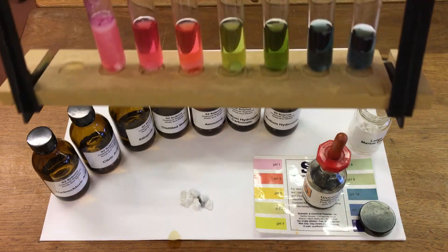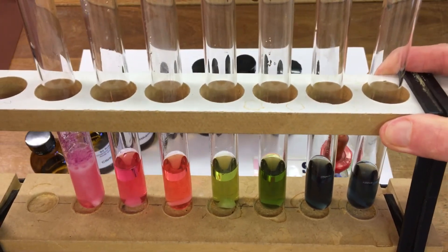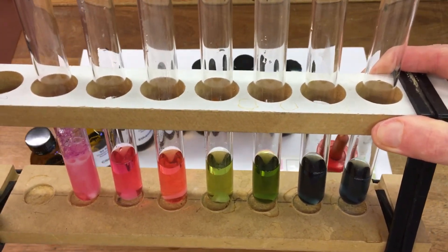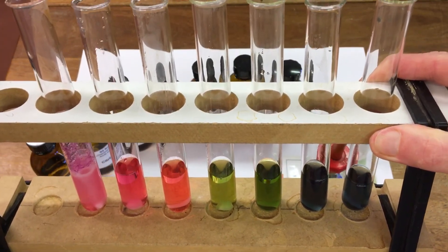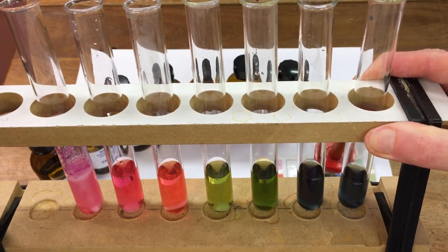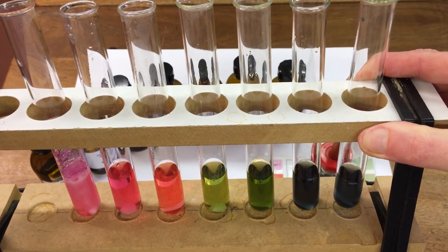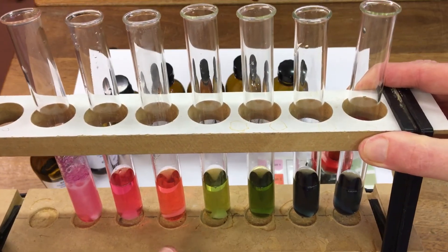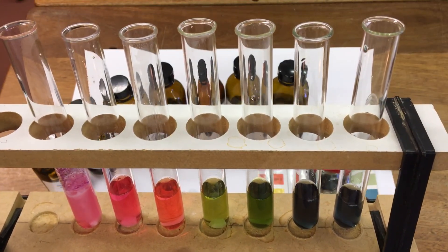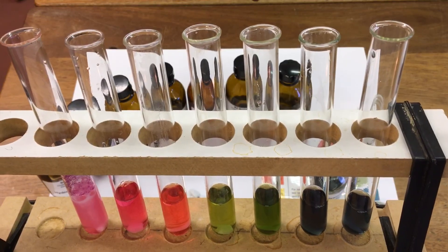Or the sodium hydroxide. So again, we can see the stronger acids produce more reaction with the marble chips.